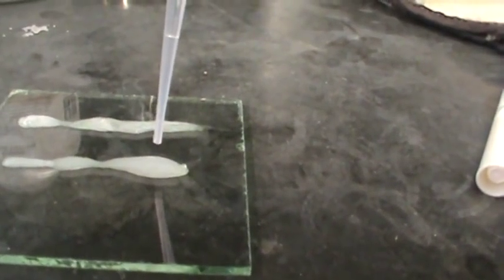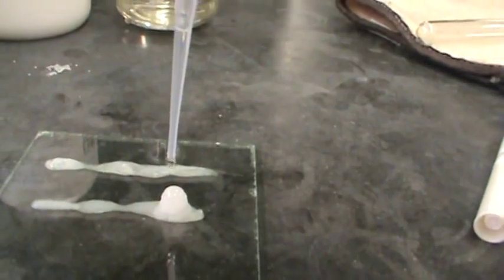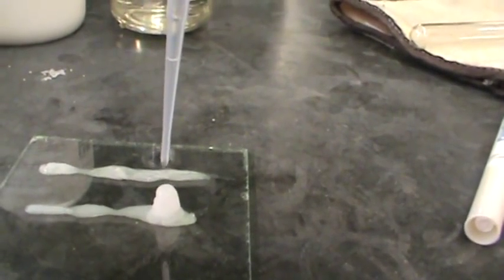Sometimes it's fun. Let's see if I can do it. To go ahead and add some of the solution to a bit of crystal that's already formed. And you can get little towers of the solid built. If you put it on there one at a time, one drop at a time, that's kind of fun.